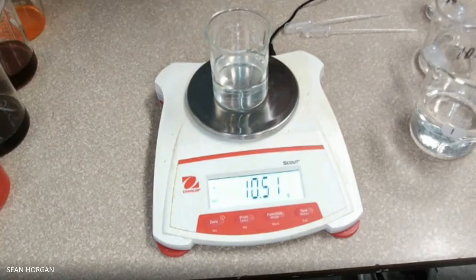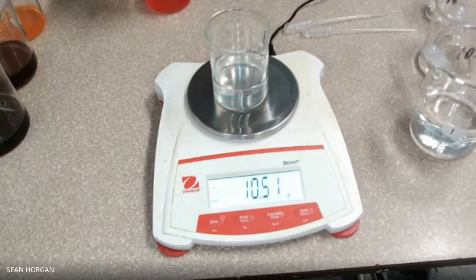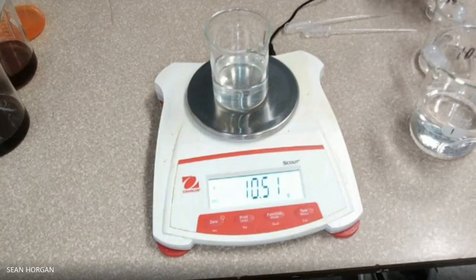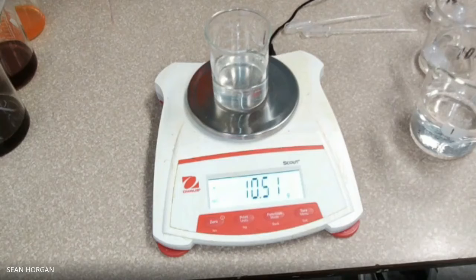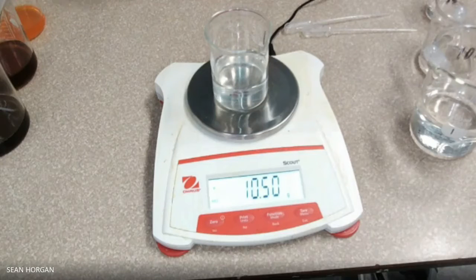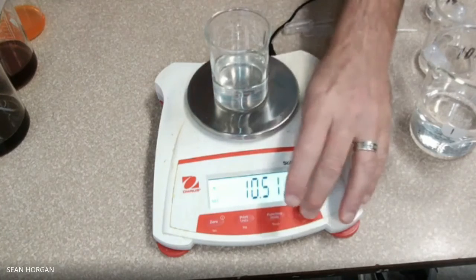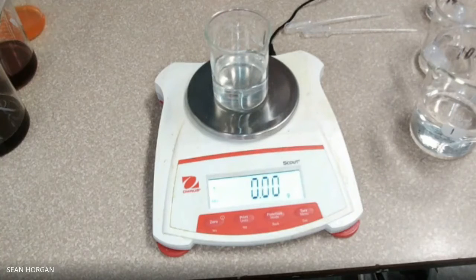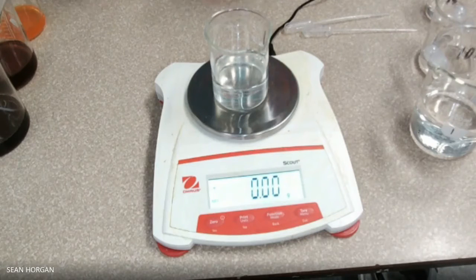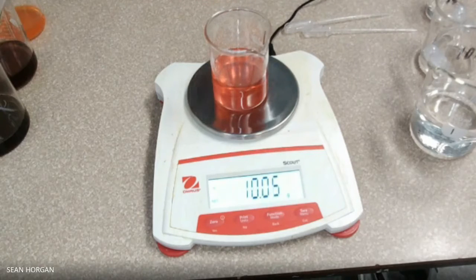Now we're going to look at the unknowns. We're going to start with Red Powerade and figure out its density. We'll hit tare so we only get the actual mass of the Red Powerade. Bottom of the meniscus — like this. I feel like you need a little more. And then we dump it in. Here's our number — that's for the Red Powerade.